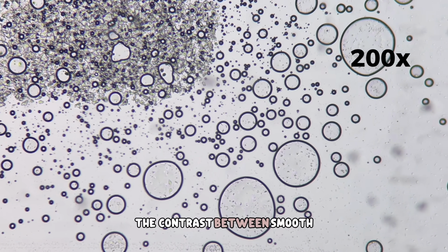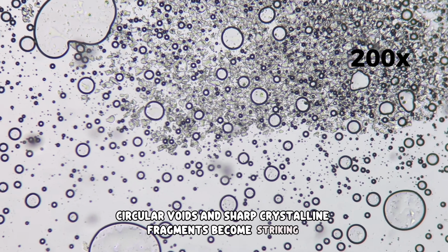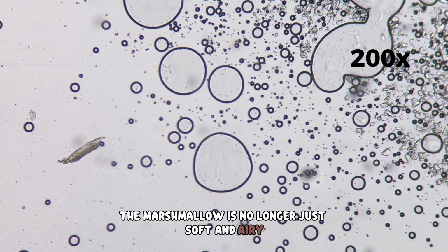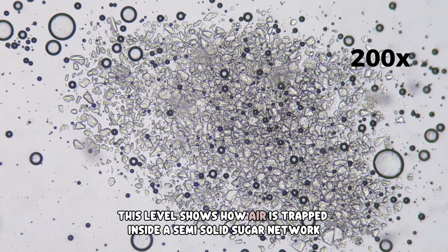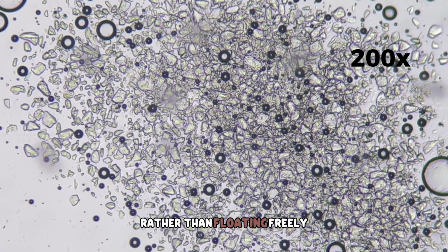The contrast between smooth circular voids and sharp crystalline fragments becomes striking. The marshmallow is no longer just soft and airy. It is structured and supported by microscopic sugar frameworks. This level shows how air is trapped inside a semi-solid sugar network rather than floating freely.